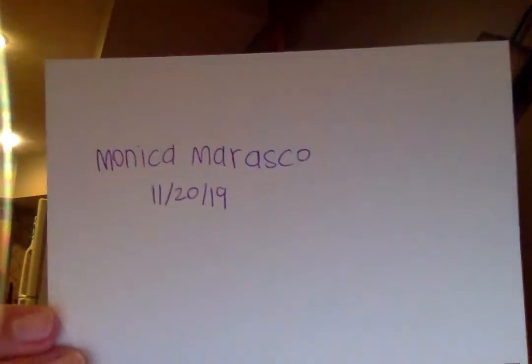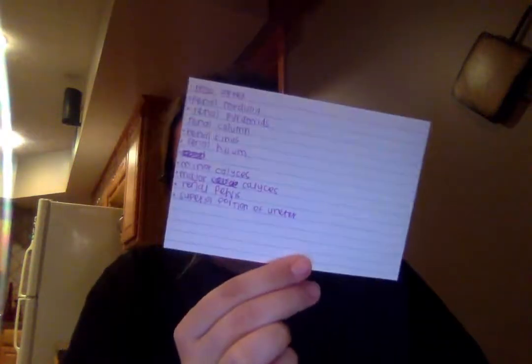Hi, my name is Monica Marasco, and today I will be talking about the sheep kidney dissection. On the other side of this paper, I have the structures that we are to identify.